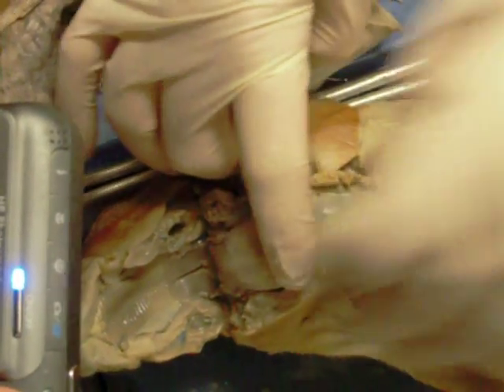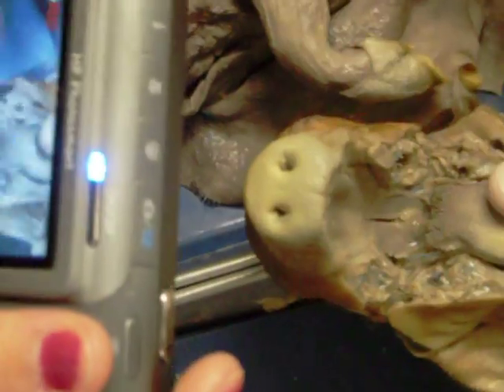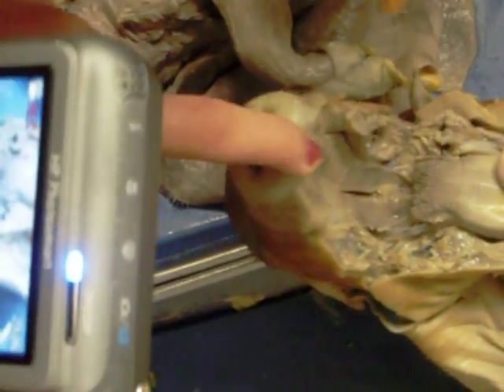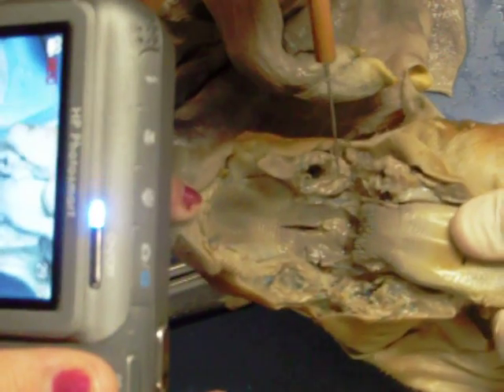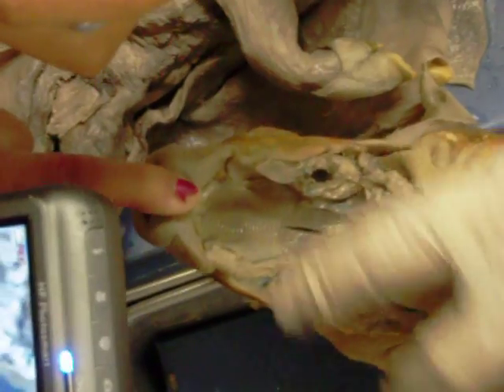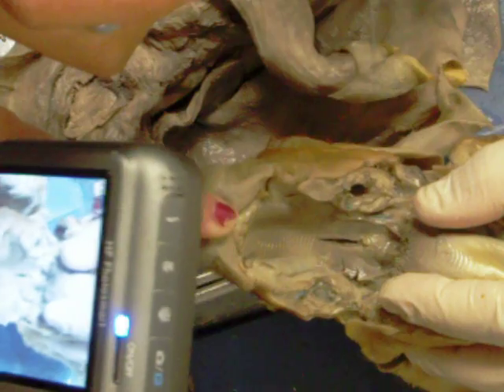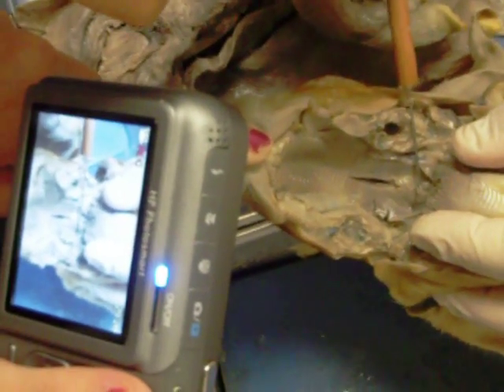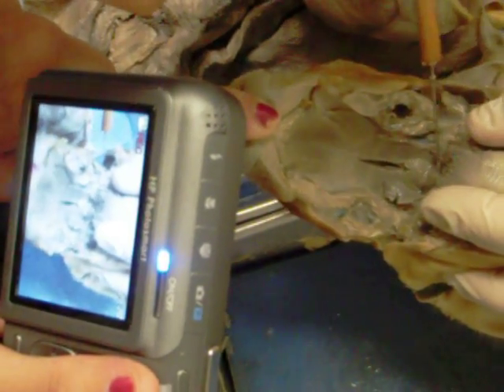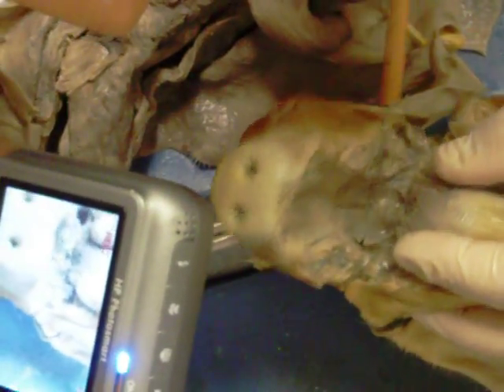If we open the mouth even further, we expose the epiglottis — this little flap right here. The back of the mouth is commonly known as the pharynx. The epiglottis covers a hole called the glottis, and I just tore it.